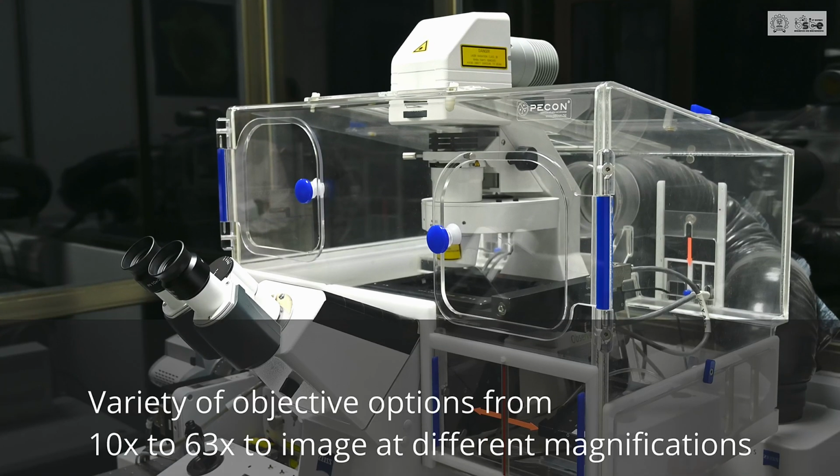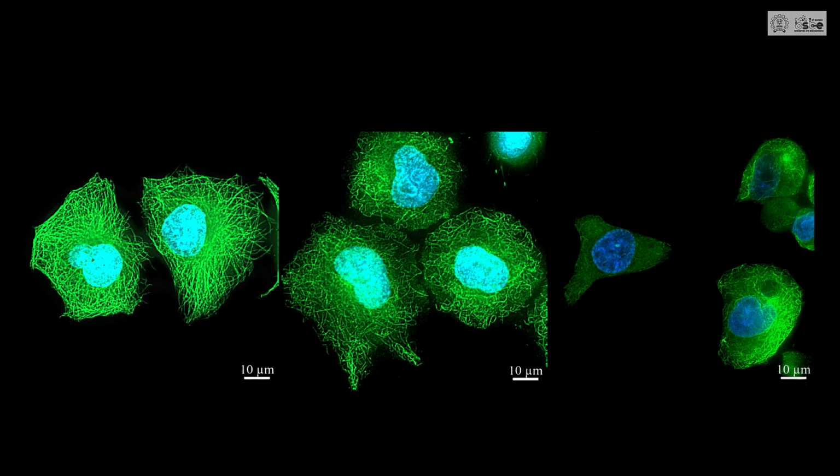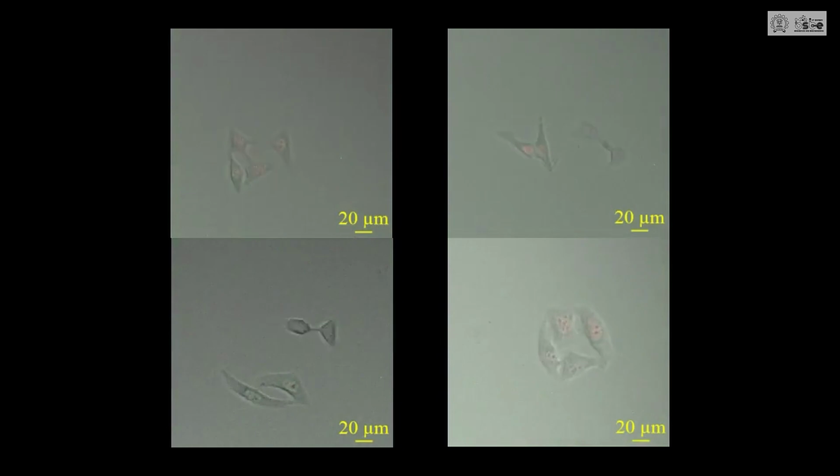For example, it can capture swimming bacteria at 50 frames per second at full resolution. It is a very powerful tool for live cell imaging over hours to days. It is suitable for imaging fast dynamic processes and multi-position imaging.